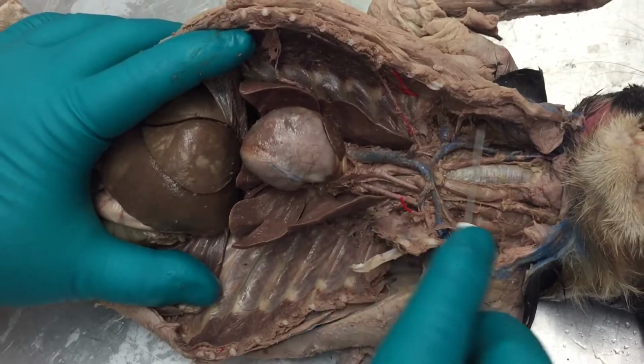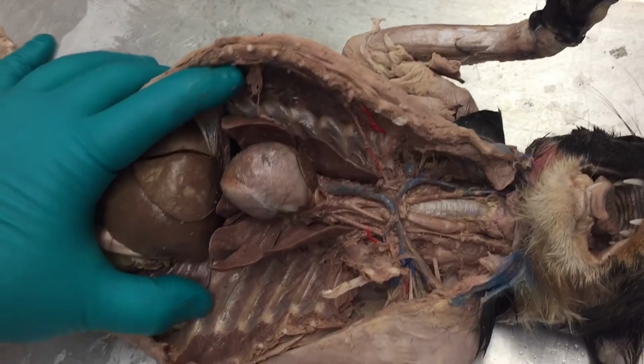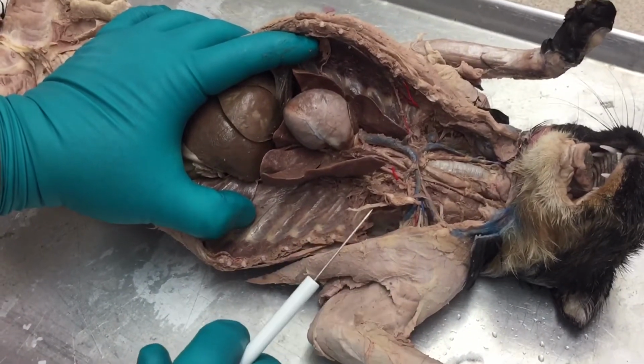So that takes care of all of them that are found in the chest, and then you have the ones in the arms, which are brachials, and the ones in the legs, which are the femorals. And that's your entire test.